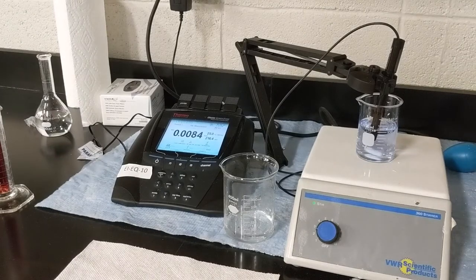So this was my blank. I'm expecting it to come in fairly low — I typically see values anywhere between 0.01 and 1 part per million. If it's as high as 1 ppm, that could indicate a problem with your deionized water. Lately we've been seeing it fairly low. If it's below 0.1, that's good, because that's our low standard. I'm going to give this time to equilibrate — I'm probably not going to do it on camera because it does take some time. But that is basically it.